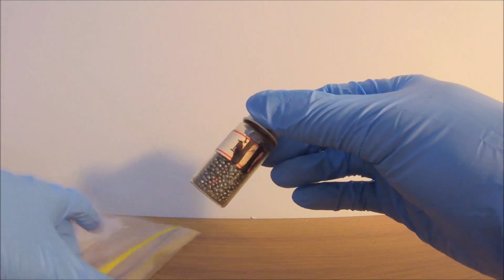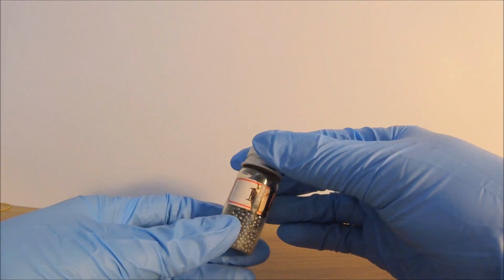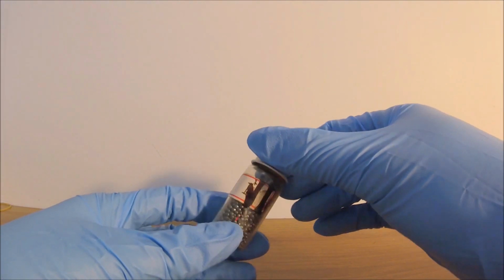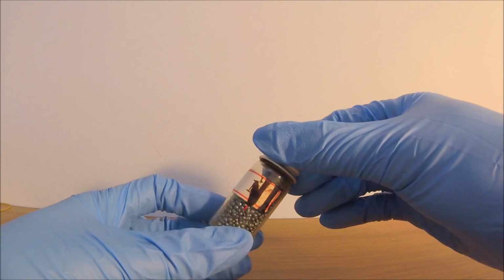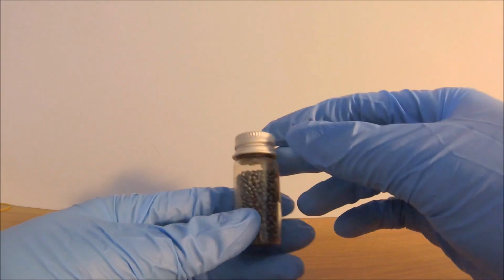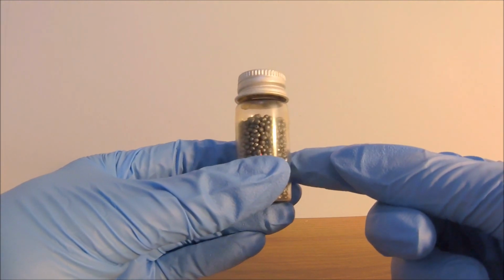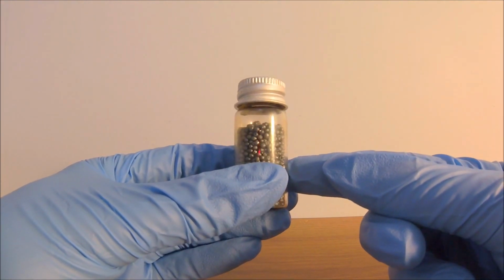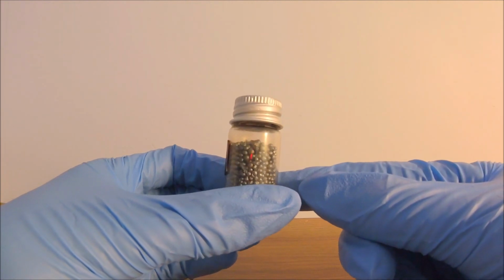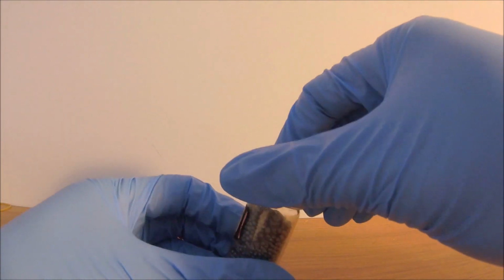Okay, the first thing that tips me off is this iodine stain on the label. This is a strong indication that some sort of leakage has occurred during the last year of storage. Wait a second. If I remember it correctly, I filled this vial all the way to its top. Now as you can see, there is a very noticeable empty space.